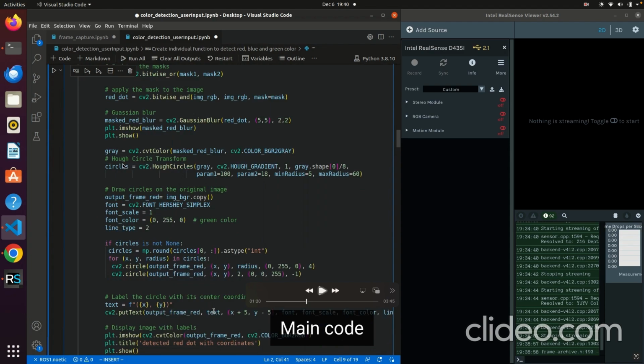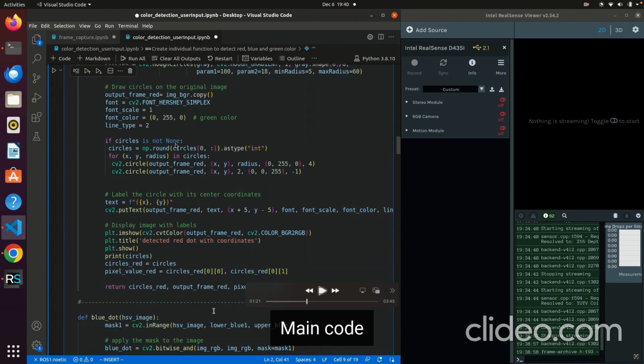For the Hough circle transform, what Hough circles does is it gets the circles in the image. So you will get the input gray image, and then you will give the parameters: the minimum and maximum radius, and the parameters param1 and param2. Then you will draw the circles you found with this function on the image. And these are the fonts of the detected color, so it says where it's at in pixel space. If circles are not found, then you just give the output frame. If they're found, then you give the detected colors.